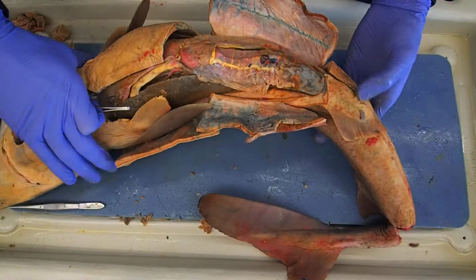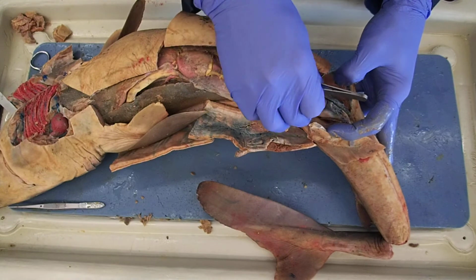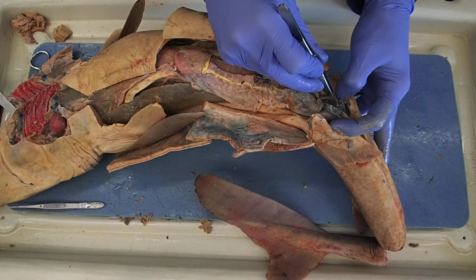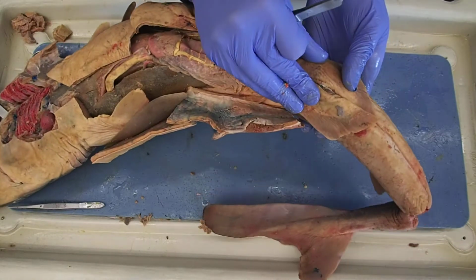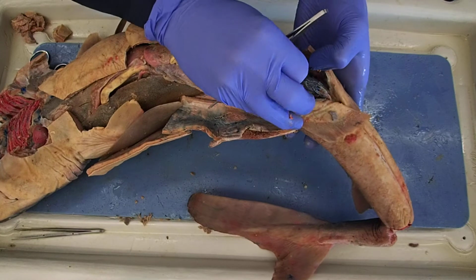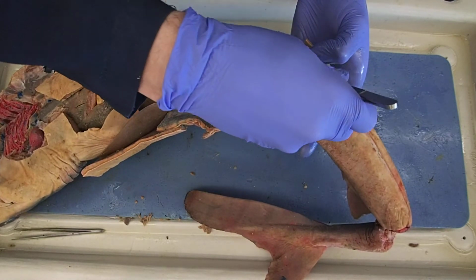Once we go from the duodenum, we go into the valvular intestine. And then we go from the valvular intestine down into the colon technically, and then here's the rectum. The rectum empties, should cut through it here, into the cloaca. So if I put everything back together, this would have been the cloaca. If we go into the cloaca, you can see my rectum emptying in. So technically, that would be the anus.